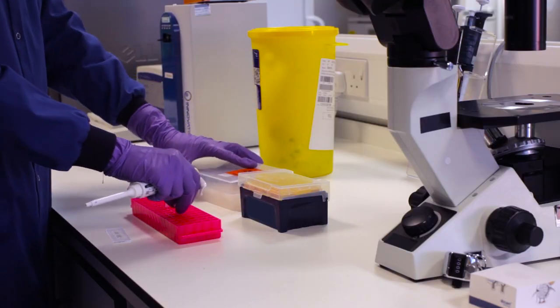To begin counting, prepare the disposable haemocytometer. Using a P200 Gilson pipette, take 100 microliters of suspension and add to 400 microliters of Trypan Blue 0.08%, and mix well.